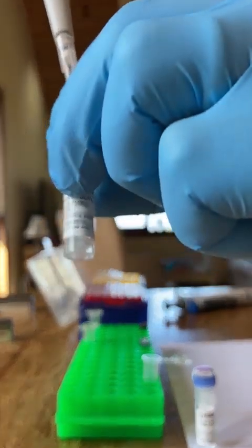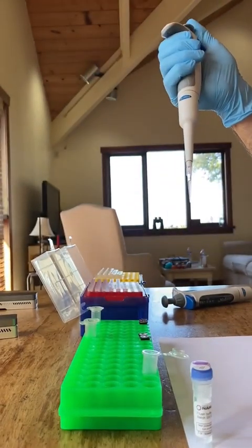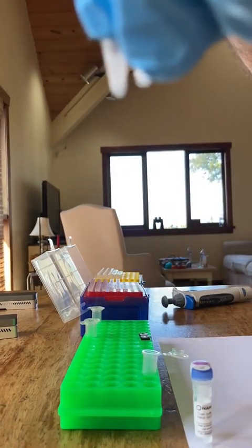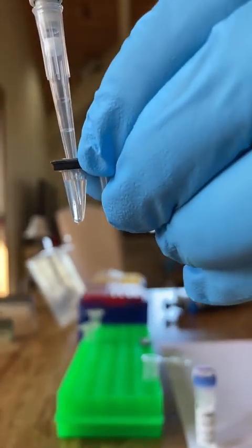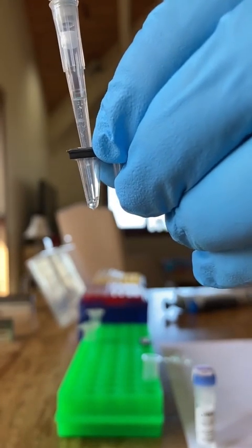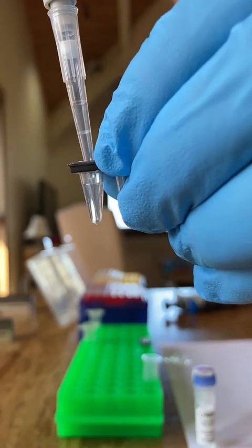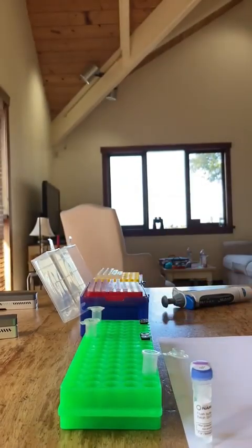And what's happening during those temperatures is the DNA is being cut in the first step, and an adapter is being attached. The second step that's going to happen next is we're going to attach another adapter to that tube after we take it out of the PCR machine. And that second adapter is a sequencing adapter.